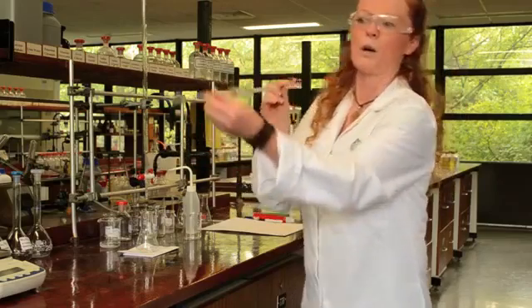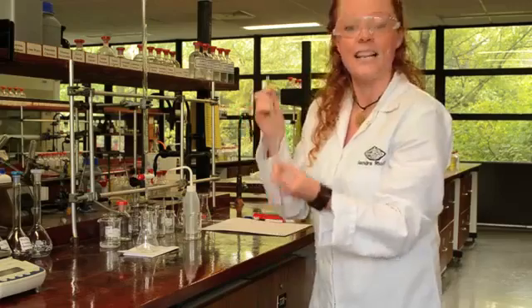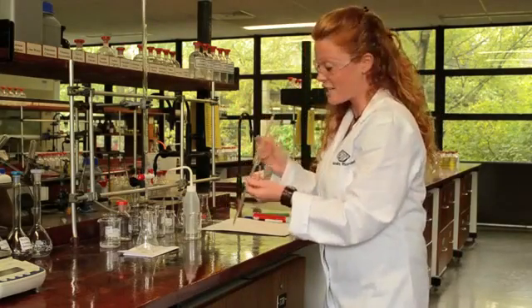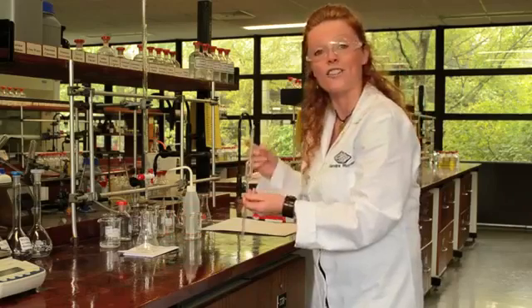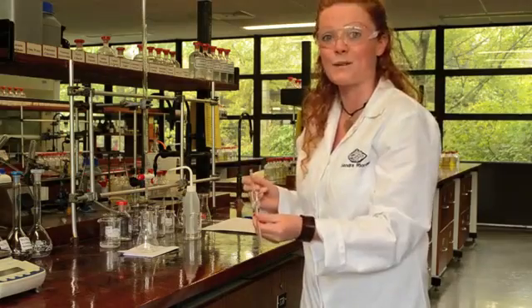Now, this looks like a blow dart or something, but no, that's not what it's for. It's actually an accurate measuring device for the base that goes into the conical flask for the titration. These are two very important pieces of apparatus not to be messed with.